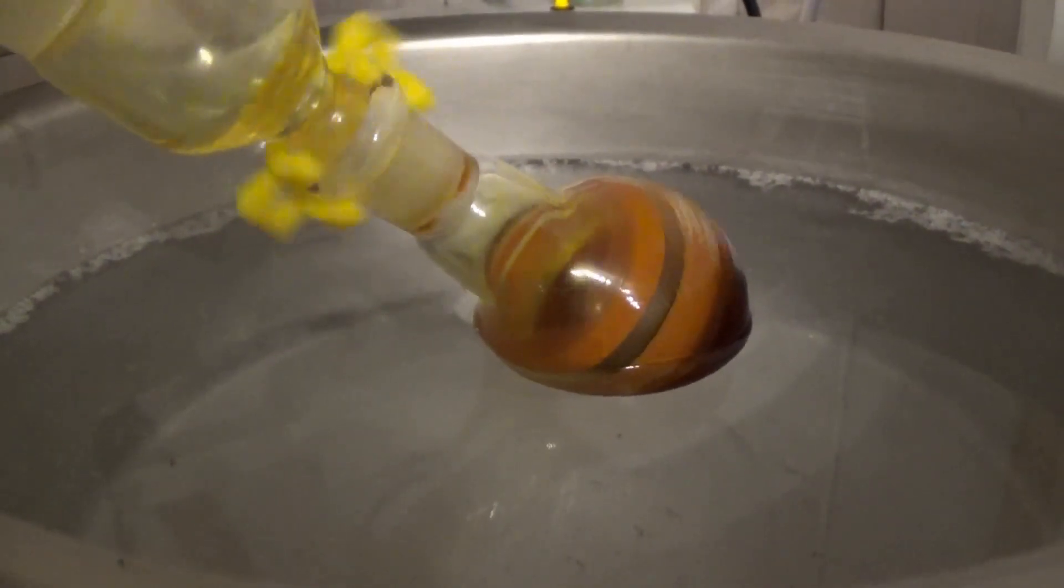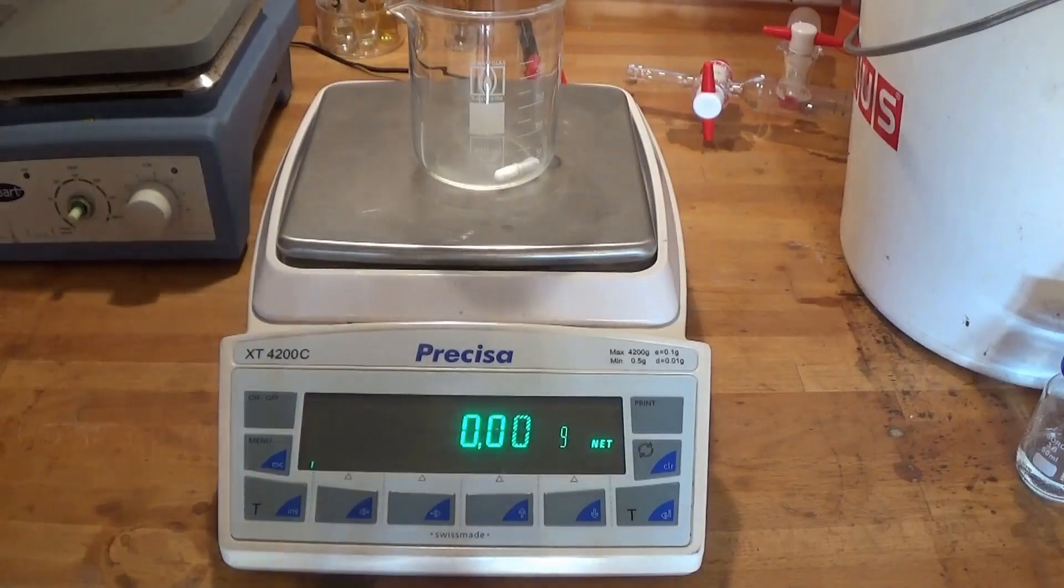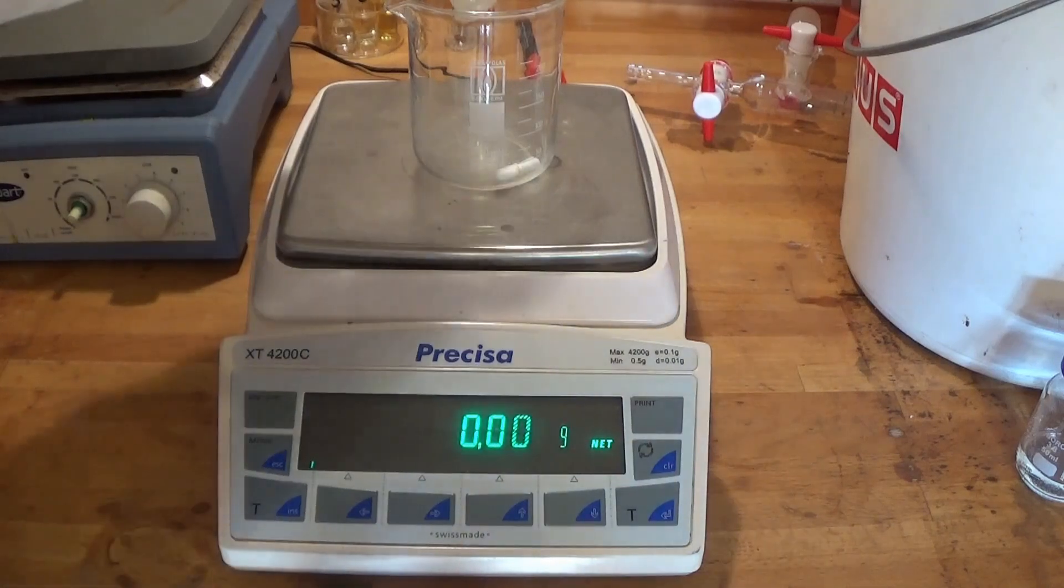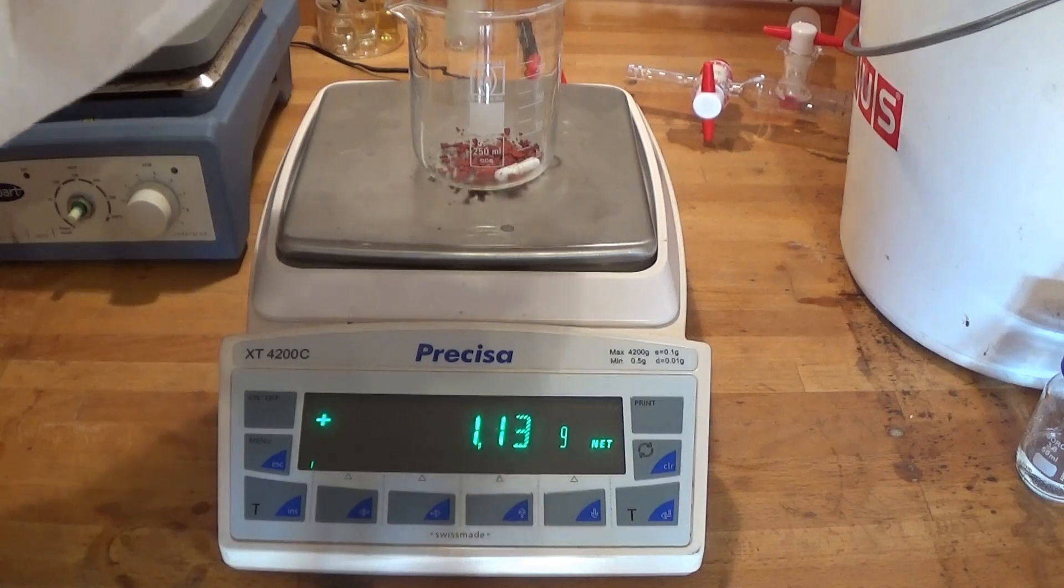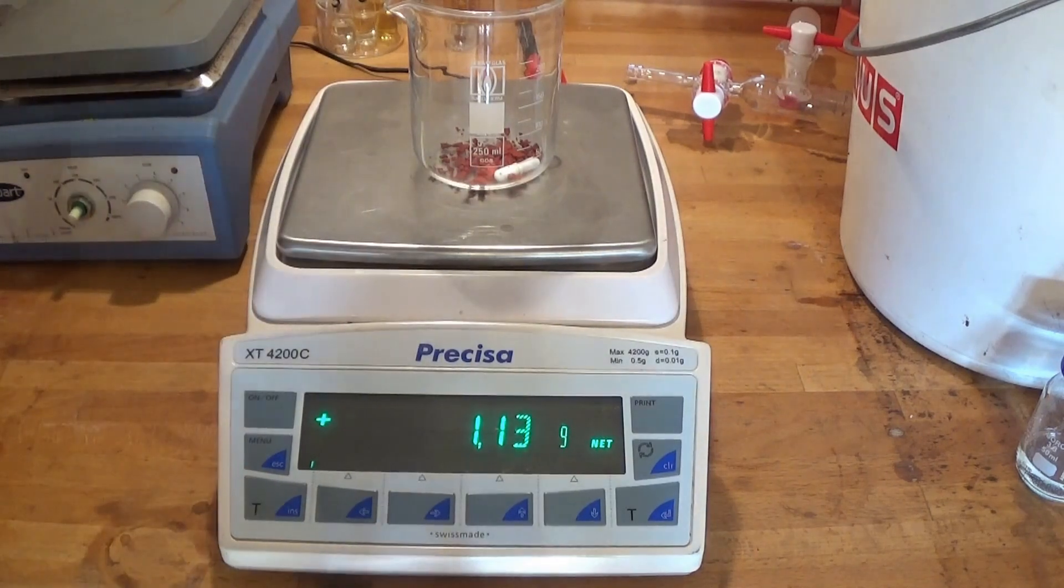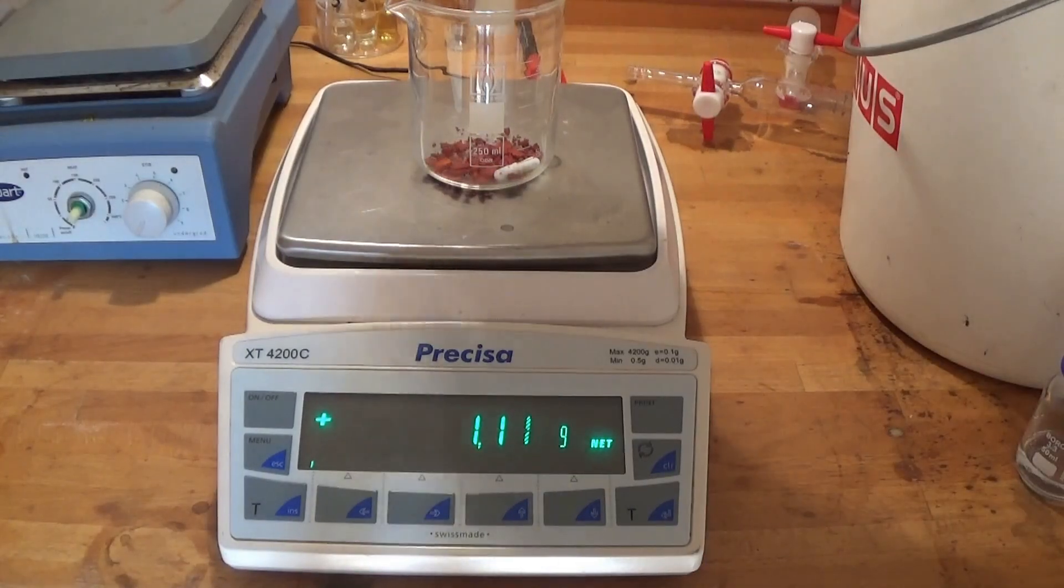Due to the high percentage of side products it was impossible to clean up the crude product. I am posting this video because I think it is very important to learn from failure. In this case it is mine. But for the future you and I know that fact-checking your papers is important.